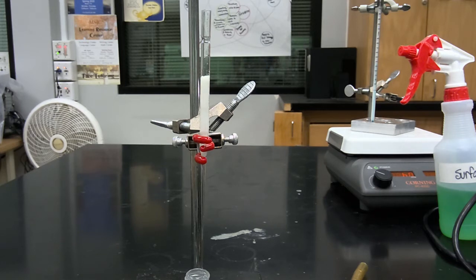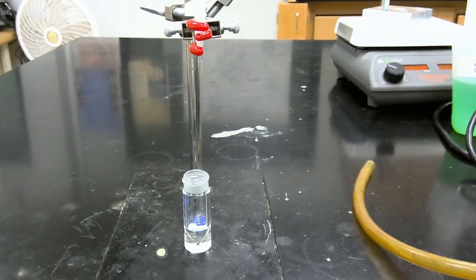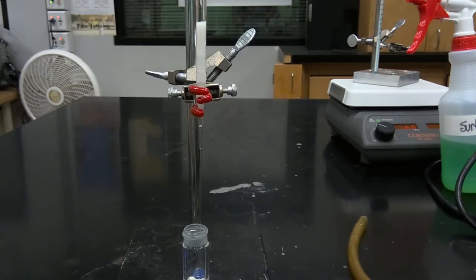Okay, so as our initial portion has eluted effectively through the column, we're going to add another milliliter of dichloromethane to ensure all of our product has been successfully eluted through our column. And again, we're collecting our product mixture in our tared conical vial. So we'll resume once this elution has fully completed.